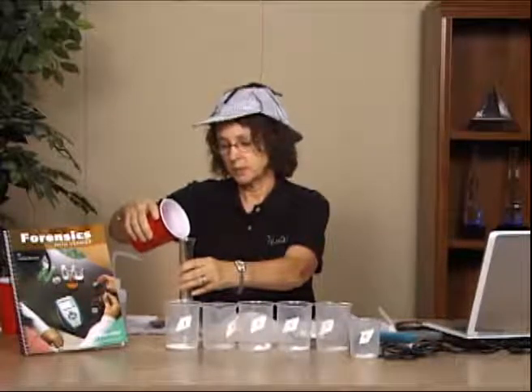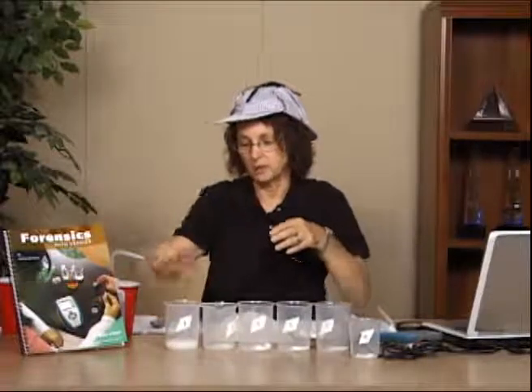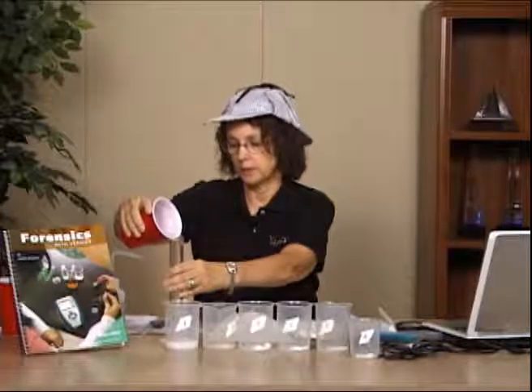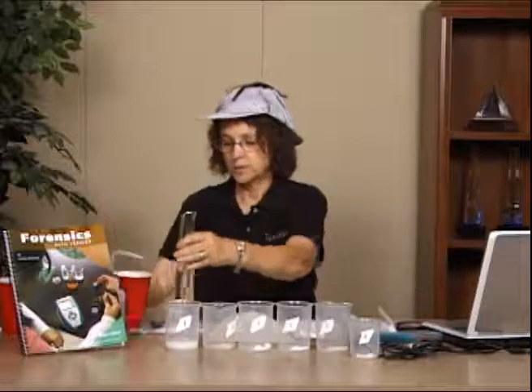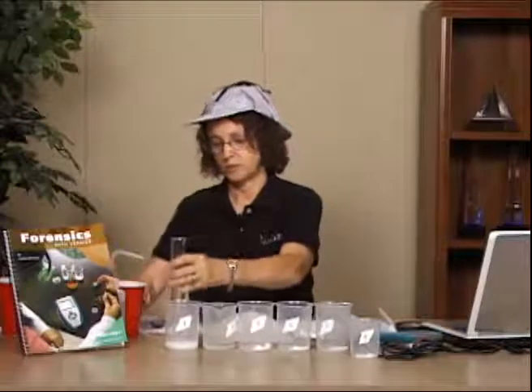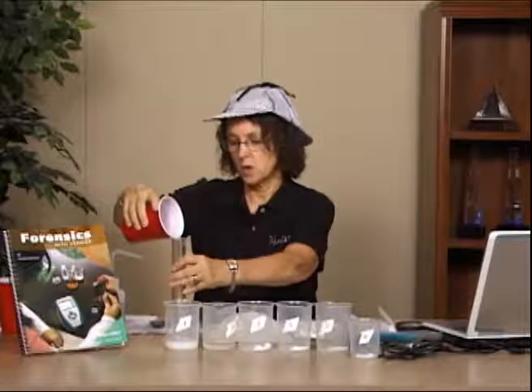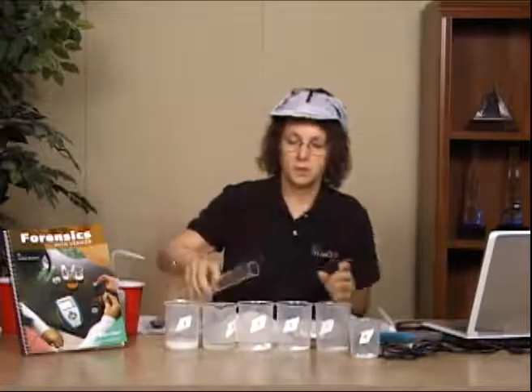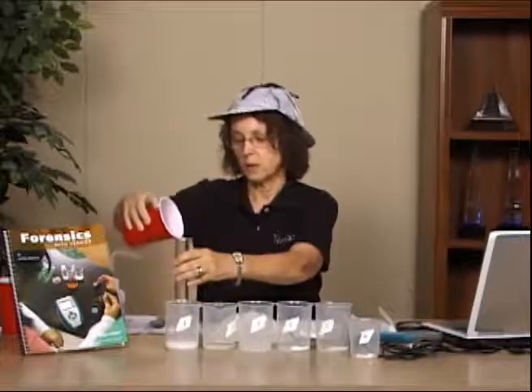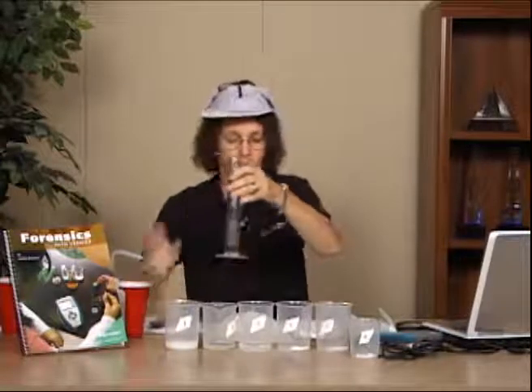The problem with this particular next step is going to be that we then have to let them sit for 15 minutes and stir it every 3 minutes. Now that poses a little bit of a problem in my classroom, because sometimes my students are on task, and sometimes my students, given 15 minutes to do nothing but swirl a beaker, could be a little bit off task. So what I suggest you do is that while you have your students do this next part, that you also then go on and do some of the other analysis, which you can do, and we'll speak to that in a minute.